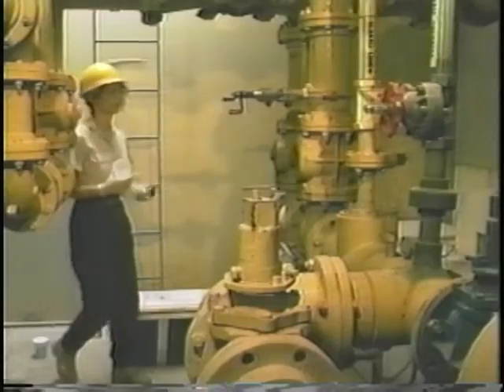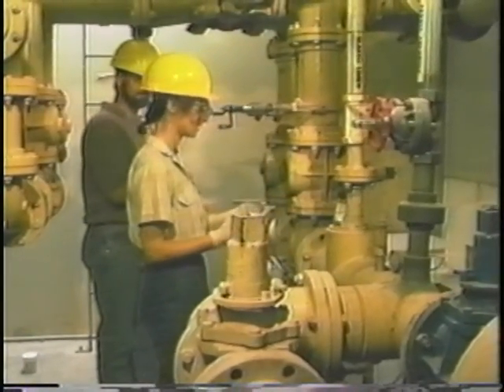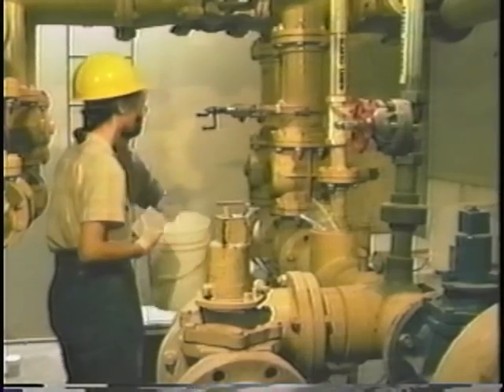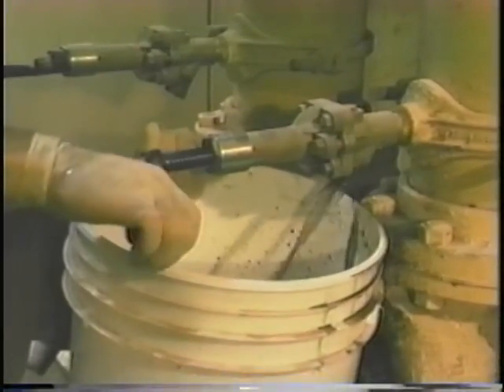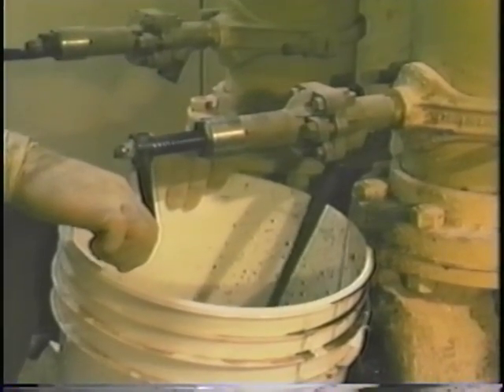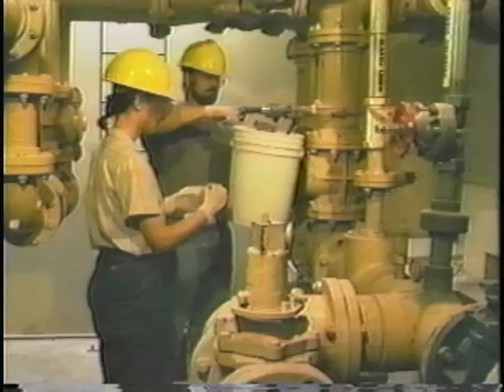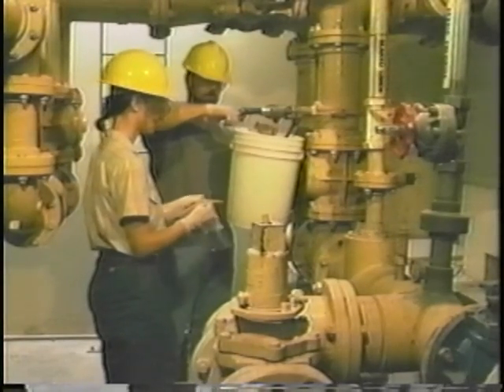You must make sure that you sample from the line that's discharging the final digested sludge and not raw or recycled sludge or supernatant. The discharge line and sample tap must be purged of old sludge before samples are collected. Make sure to let the sludge flow until the volume of the pipe has been replaced with fresh sludge, or the discharge sludge temperature matches the digester temperature. This ensures that the sample collected is representative of the final sludge that is leaving the plant.